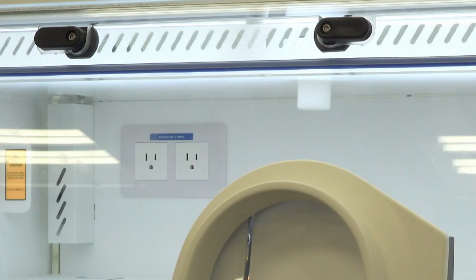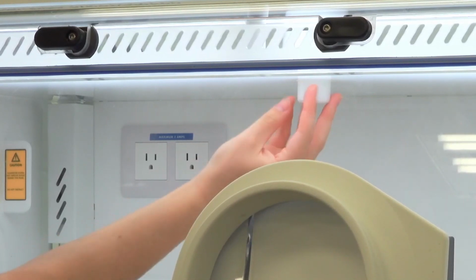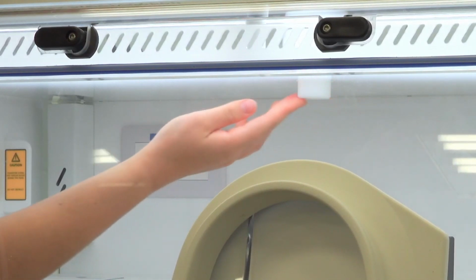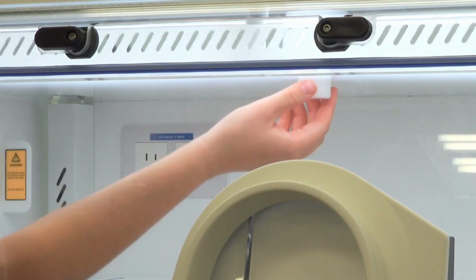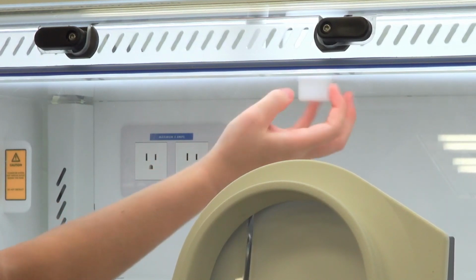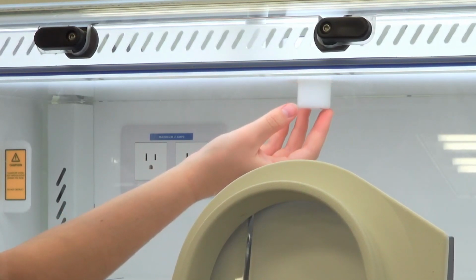As I mentioned earlier in the demonstration, on our calibration screen, we're going to see two directions that tell us to close the calibration chamber and also to open the calibration chamber. To close the calibration chamber, we're going to turn the chamber until it is tight to the ceiling of the workstation. This way the sensor is isolated to the cell above the workstation and we're able to actually perform the calibration. To open the calibration chamber back up, we simply twist it in the other direction until it is back open and can again sense flow inside of the workstation.